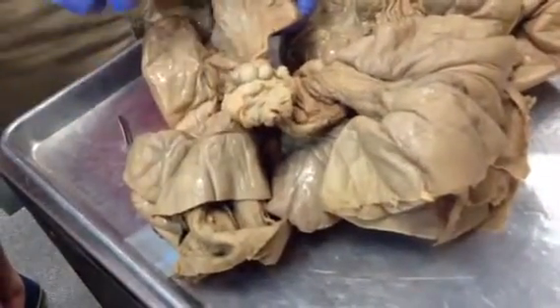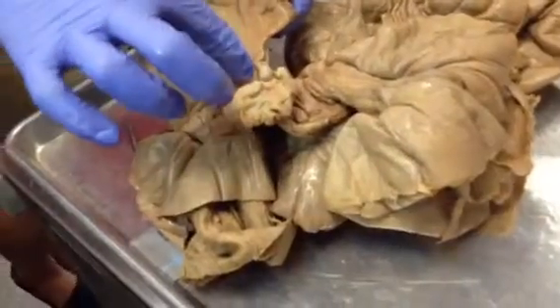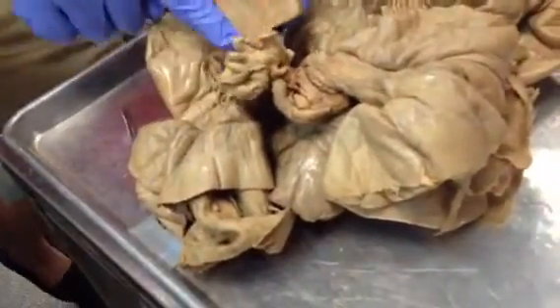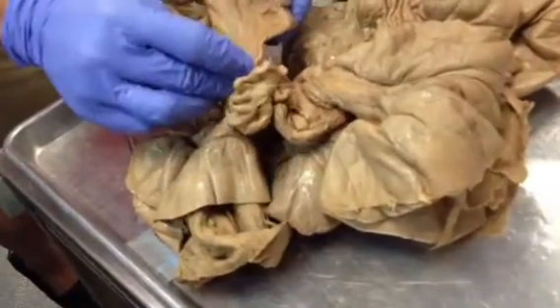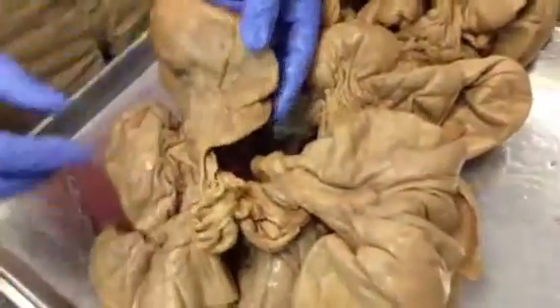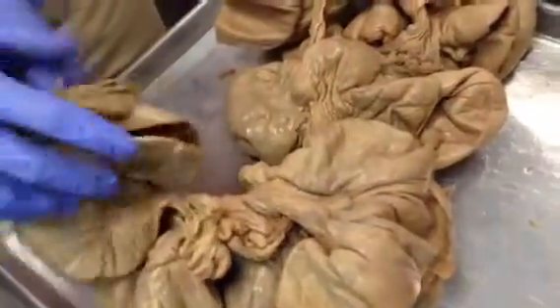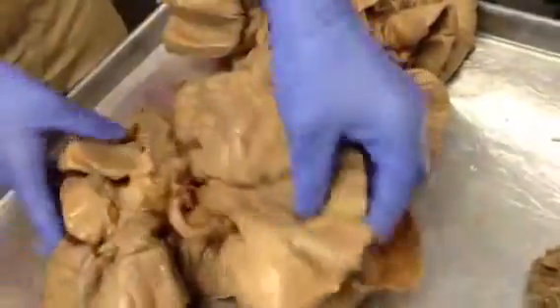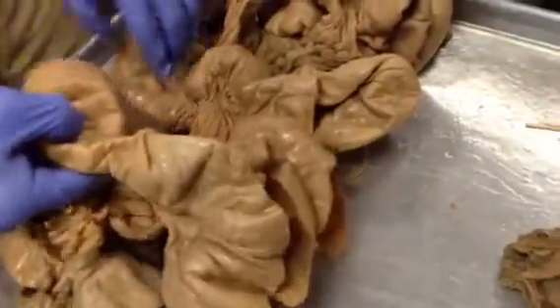So the egg, before it made these piglets, this is a pregnant uterus, the egg came out of there, it was caught by that hoodie thing, and it went into the tube, it was fertilized in the tube, and all those little embryos made their way and implanted into this uterus, and we have a bunch of piglets. In fact, I think I just passed up the one that remains. Oh, what? Hey, what? It's a baby piglet.